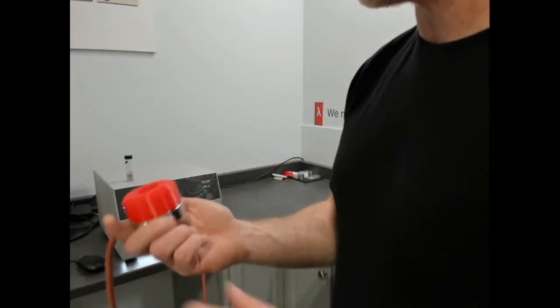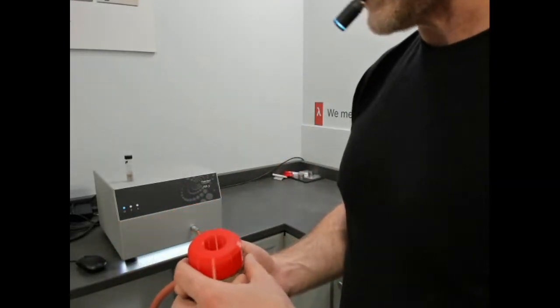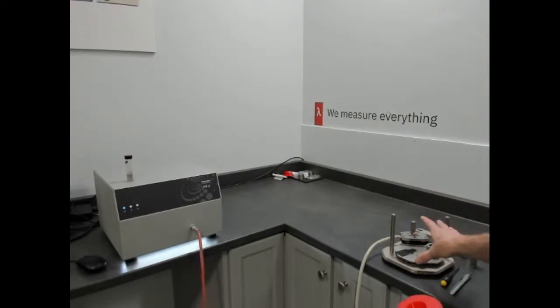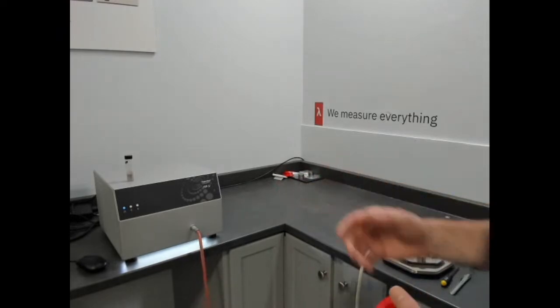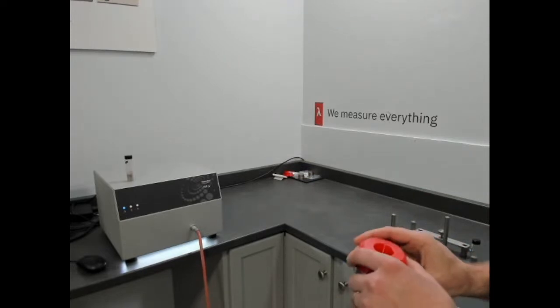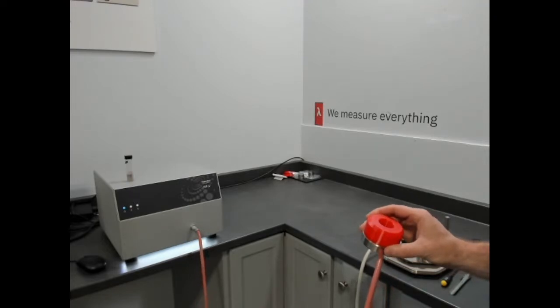So we'll be setting this up for powders and setting a measurement, showing the software, as well as demonstrating a sample setup on Symmetric for an MP1 measurement. We won't necessarily be showing the software to make a measurement, but the Symmetric setup, or two-sided Symmetric, using the powder cell. That's if you don't have an MTPS sensor, how do you test powders? It's this way. It's identical for both MP-V and MP1. So we're going to change camera angle here and show the powder setup and move to the software.